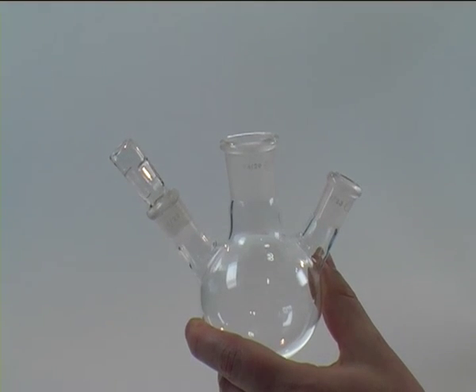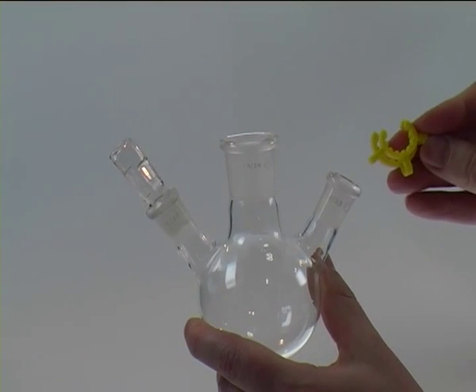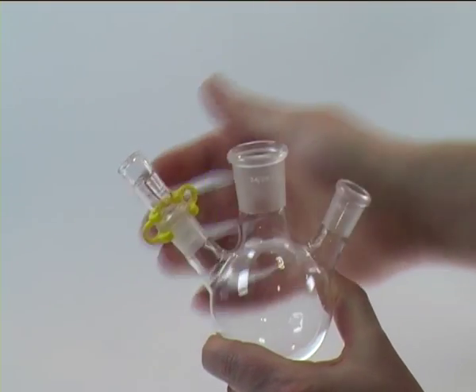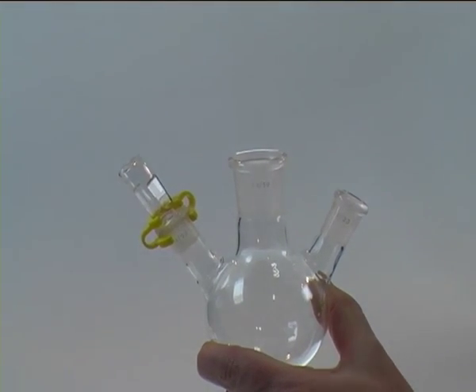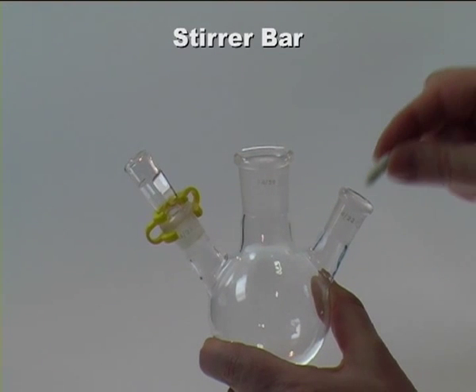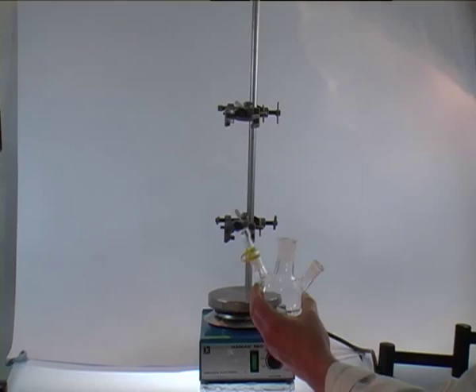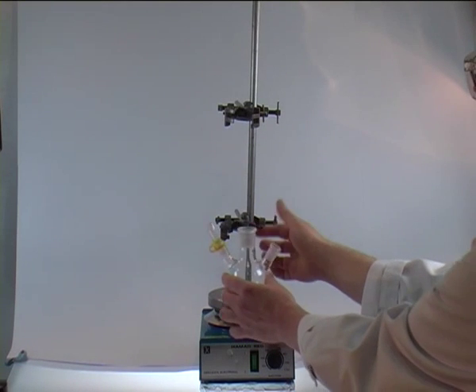That stopper has to be secured with the yellow clip so that it does not fall off. Once that is achieved, the next thing that goes in is the magnetic stirrer bar that we will need to stir our solution. And once that is in, we quickly secure that onto our retort stand.